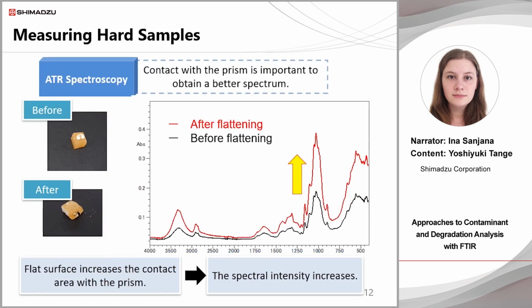Two spectra are shown here, before and after flattening. Compared to the spectrum before flattening in black, the spectrum in red demonstrates that the contact between the sample and prism was improved by flattening the sample. You can see that the contact area with the prism has increased, and with it the intensity of the spectrum. If the intensity of the spectrum is high, small peaks can be observed, and the influence of noise is relatively small, so the overall accuracy of qualitative analysis is improved.